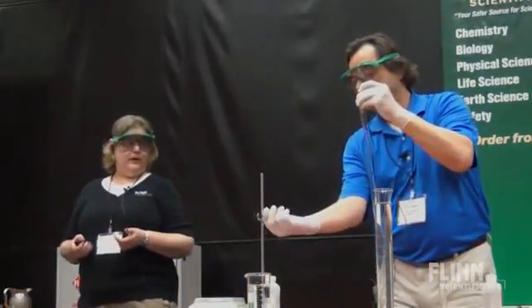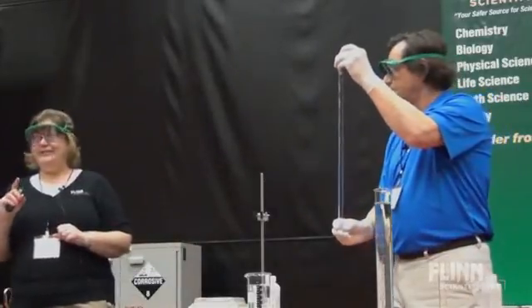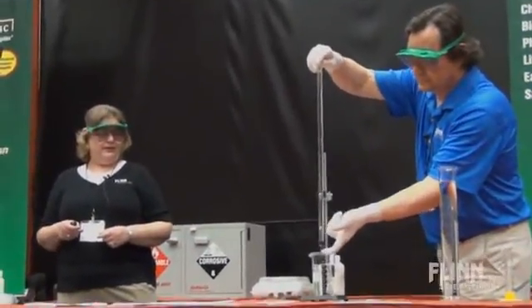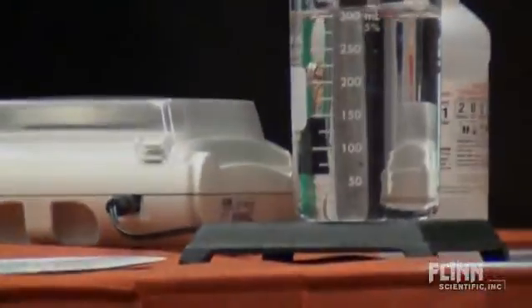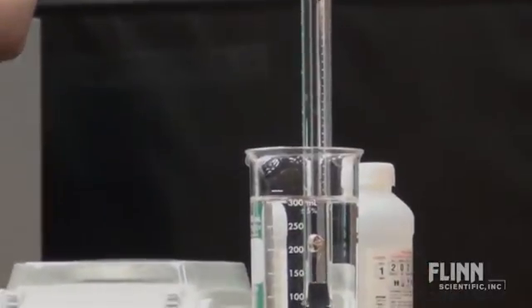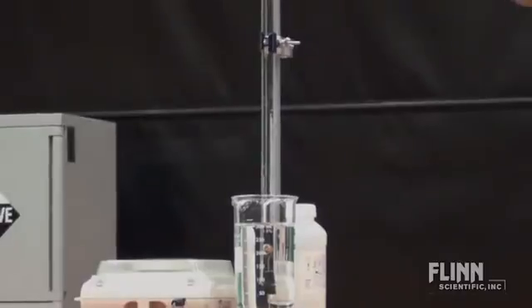He's going to go set it up, and we've got a little piece of magnesium which we did pre-measure. As the HCl begins to go down to the bottom of the tube, it's going to touch the magnesium, and pretty soon it's going to begin to react with the magnesium and start generating some gas. It's not doing it yet because the HCl hasn't made it down — that's actually a good thing.